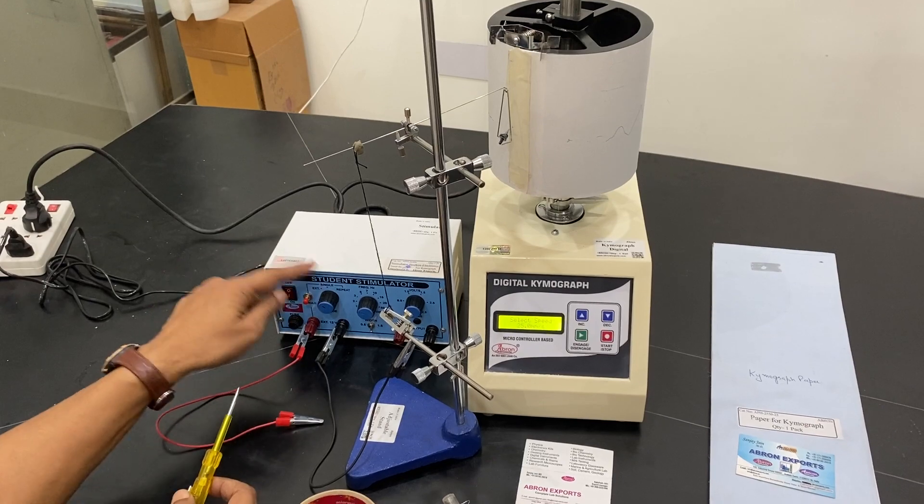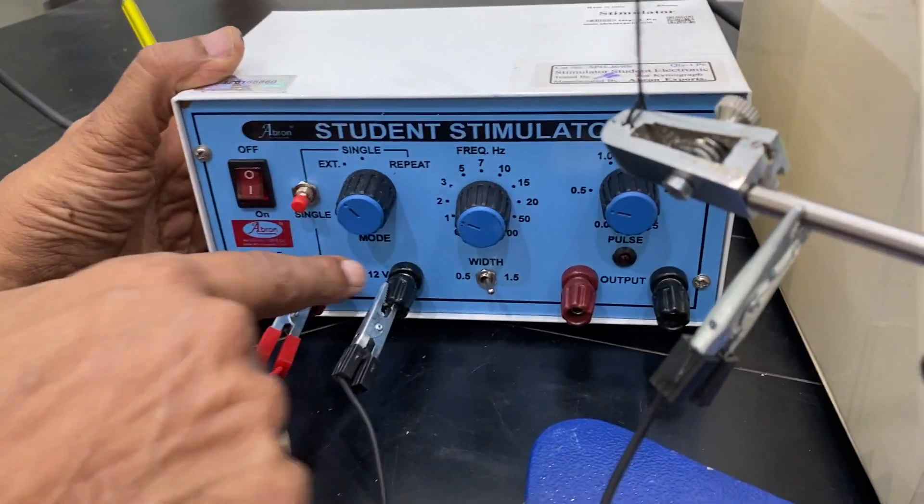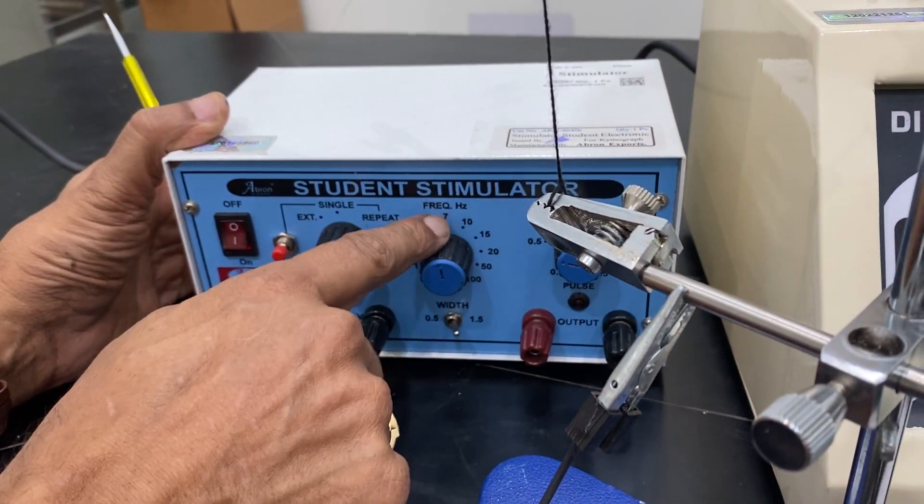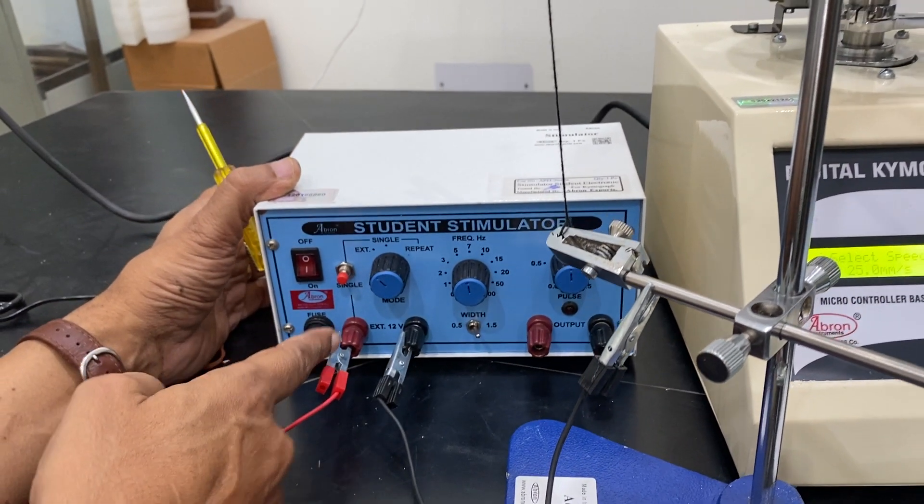Another is on the stimulator there is an external stimulation, 12 volts, and another frequency selection, voltage selection, output is there, external input there.